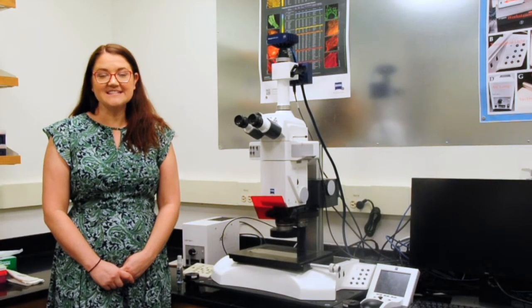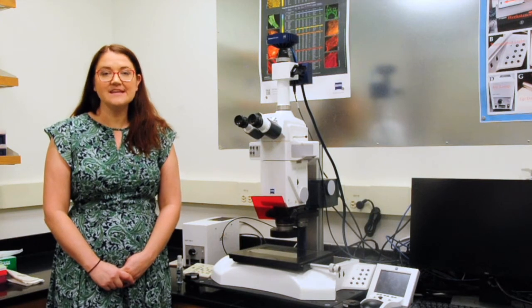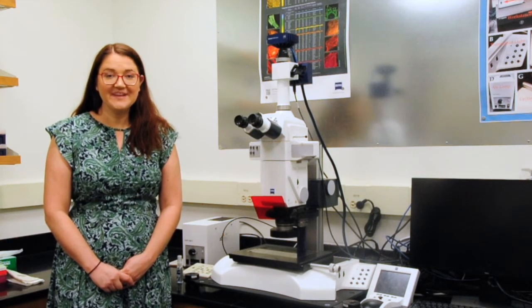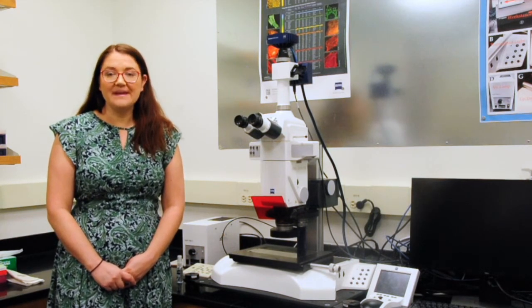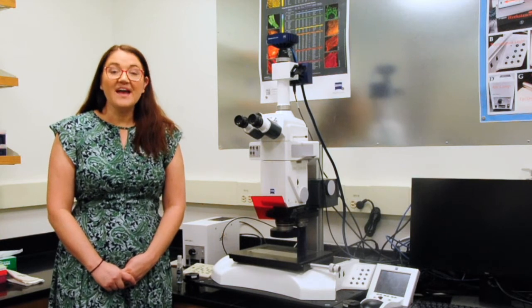Hi, it's Heather Brown-Harding, and today we're going to go over the Zeiss V16 Axio Zoom. It is a type of common main objective stereo microscope and will have very similar parts with other companies.